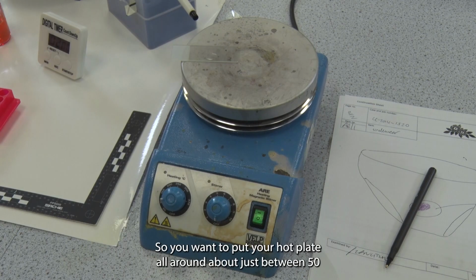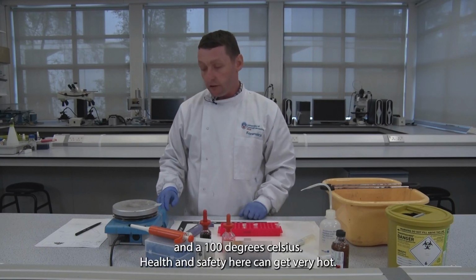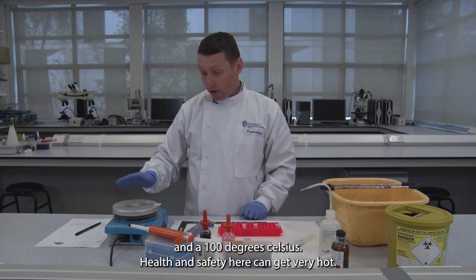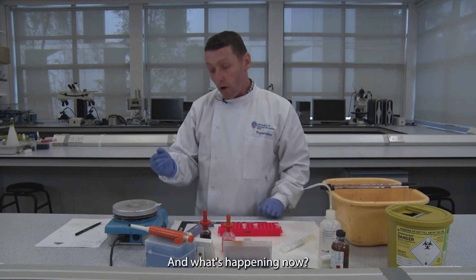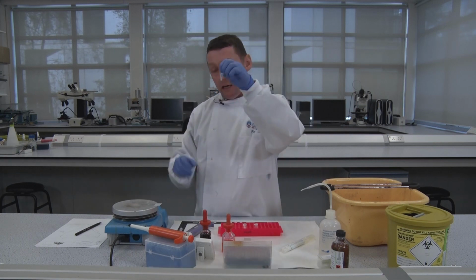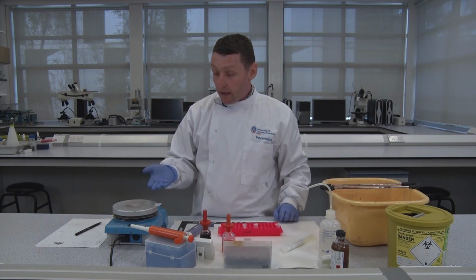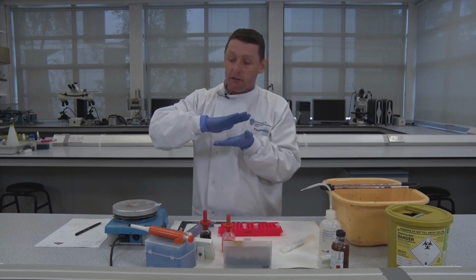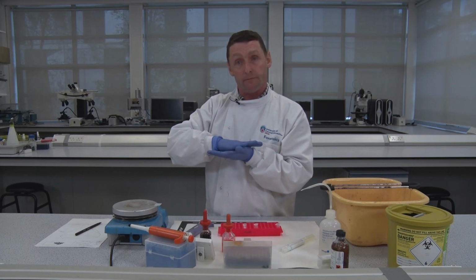You want to put your hot plate on around just between 50 and 100 degrees Celsius. Health and safety here, it can get very hot, so handle with caution. What's happening now is your resuspended pellet, a 30 microlitre sample, has been put on here, and the purpose of the hot plate is to get the cells to adhere to the glass microscope slide.